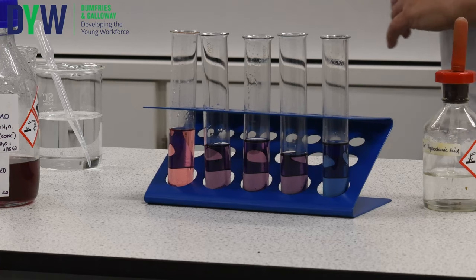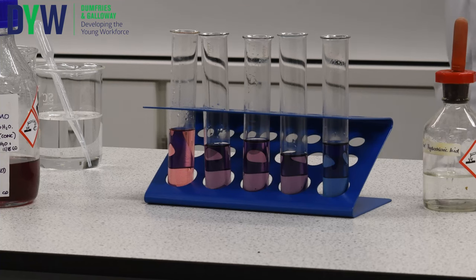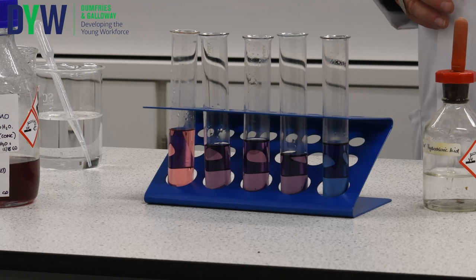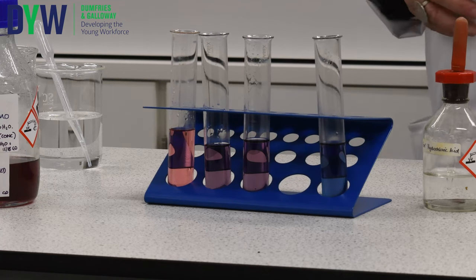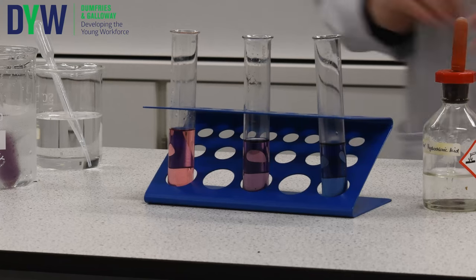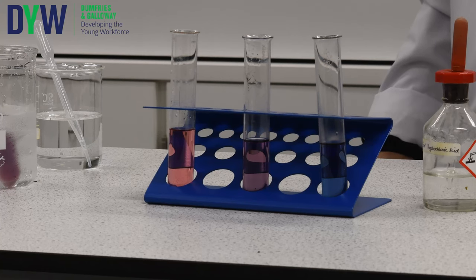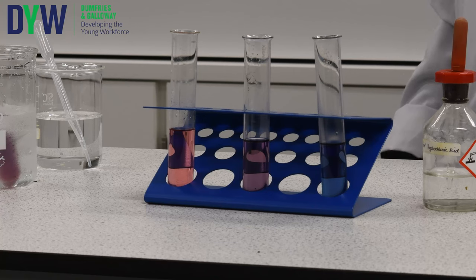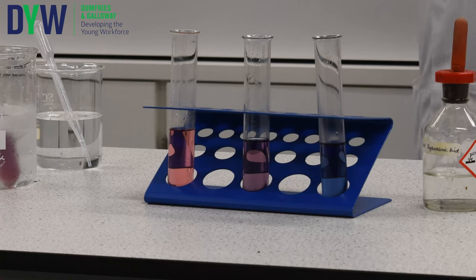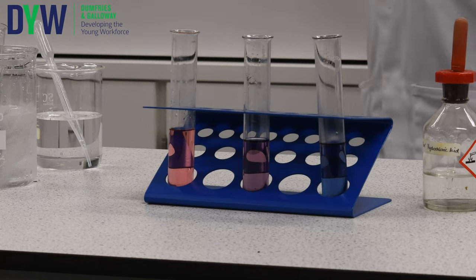I've got two important words here. Exothermic is when heat is given out in a reaction, and endothermic is when heat is taken in from the surroundings during a reaction. If we put one of these test tubes into hot water and one into cold water, we can see which way the equilibrium is pushed. The hot water pushes it towards the blue cobalt species — towards the endothermic reaction — whereas the cold water makes it go more pink, towards the exothermic reaction.